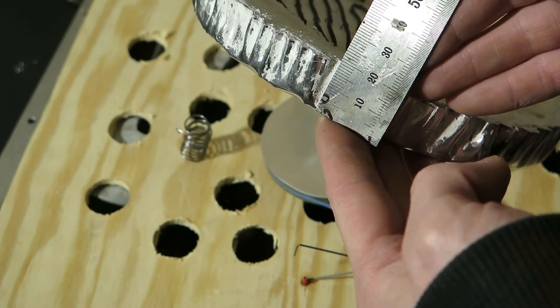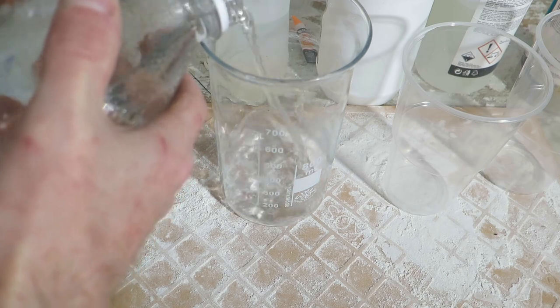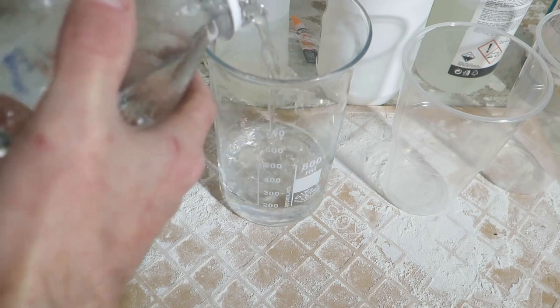Ok, enough stats now, let's look at the process. To make this thing you will need sodium silicate, hydrochloric acid, glass fiber and plaster.